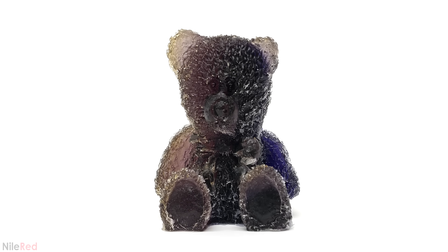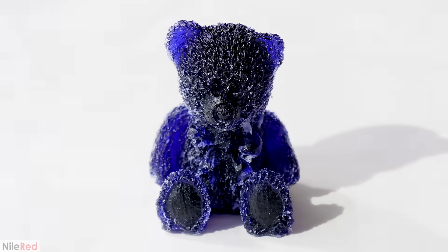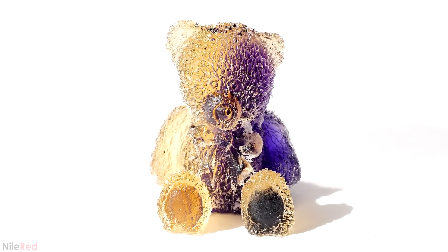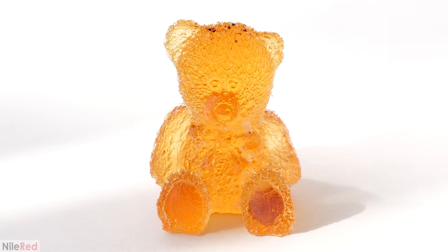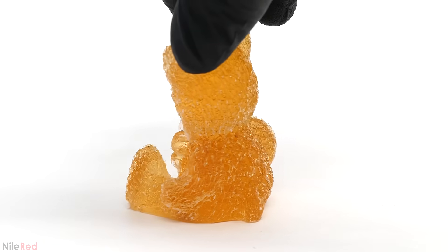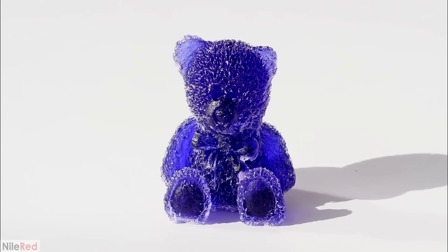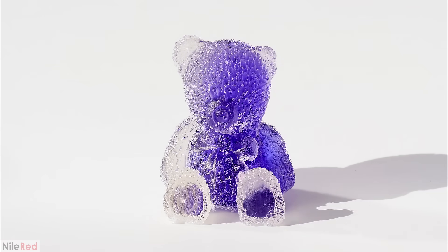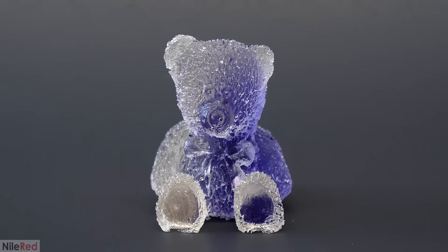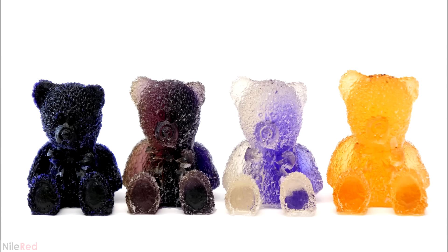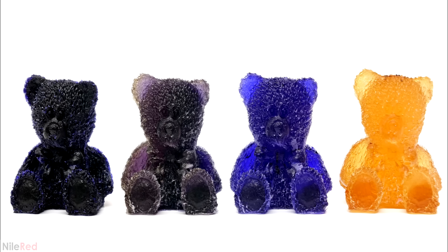Another thing to mention is that most epoxies don't do well in sunlight, and it slowly discolors. I just used it because it was something I had on hand, but if I were to do it again, I'd probably use a different polymer. Anyway, I made a couple other bears, and I did some more runs just to check a couple things. For this one, I just wanted to confirm that it was possible to change the entire color of the bear if it just sat there long enough. And not surprisingly, it was, it just took about twice as long as the other time. This last run had a much lower concentration of DNBP, and it changed much quicker. It was also colorless, instead of being yellow. I then left them for a couple more days, just to see how long they'd take to turn back. The only one that really reverted, was the one that was left in the sunlight for the least amount of time. The first one that I did, appears to still be slowly changing, but I'm not sure if it'll ever fully go back. The one that I turned completely orange, and let sit in the sunlight for the longest amount of time, seemed to be stuck that way. Maybe it will eventually change though, and if it does, I'll be sure to update you guys.